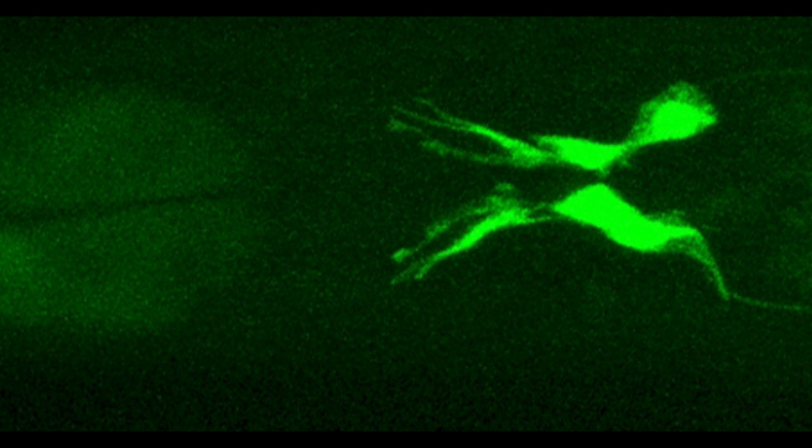We're now ending this chapter with some images taken by James Goh and Ray Hong of a favorite species of nematode. It's green because it is expressing green fluorescent protein, which is actually reporting on the promoter from a gene of interest. It is expressed in the cells of the excretory system. This is a maximum projection of multiple still images. Notice the two faint GFP expressing canals on the right, as well as the fine ducts on the left. These structures were not visible using a standard epifluorescent microscope.